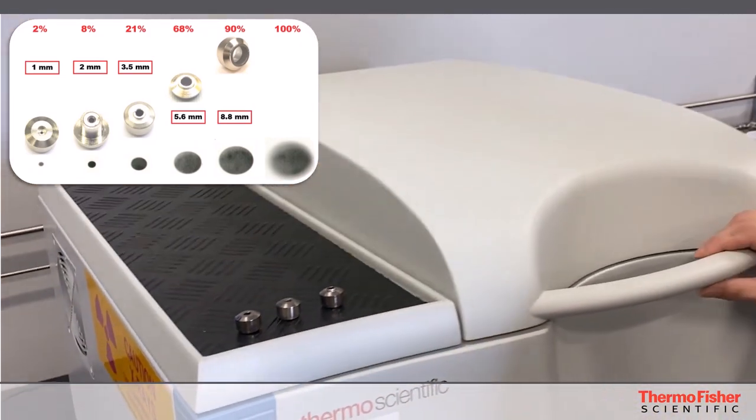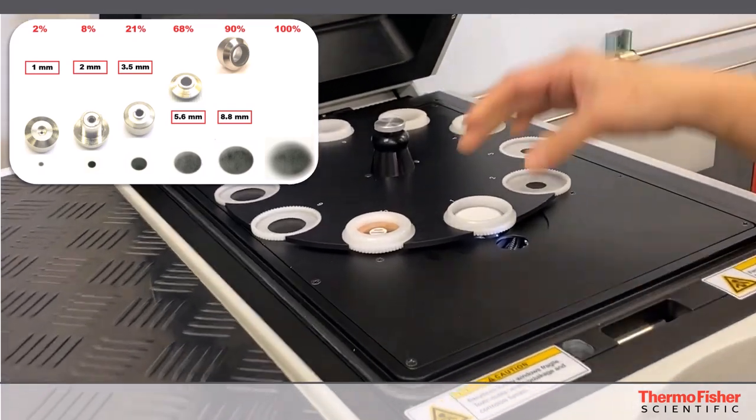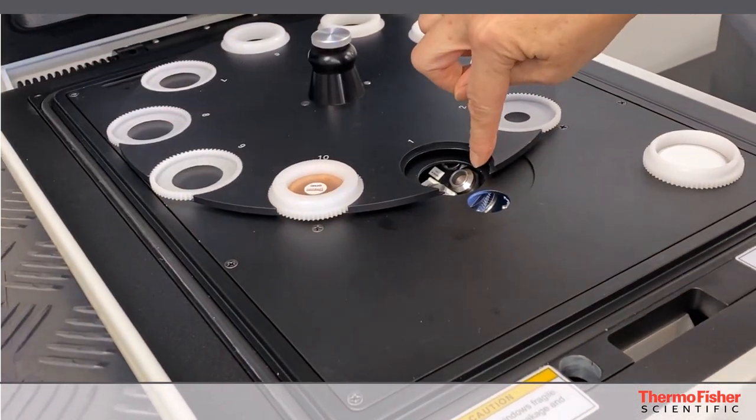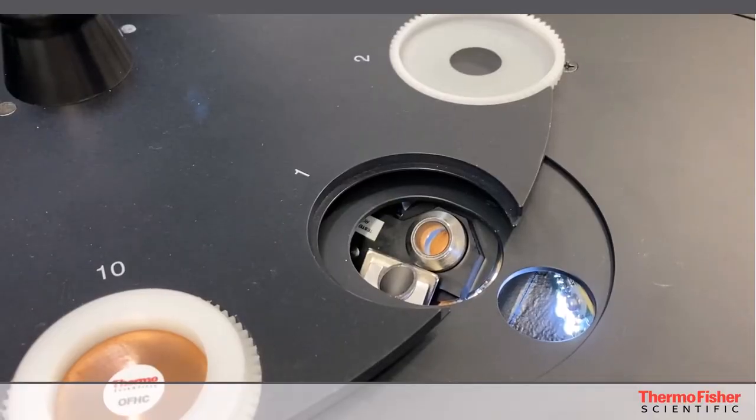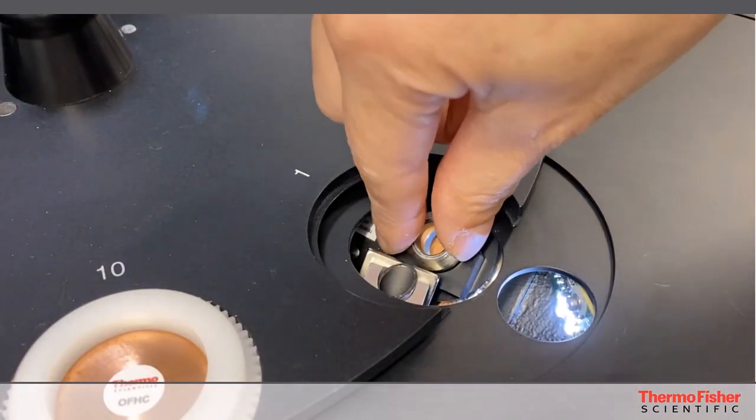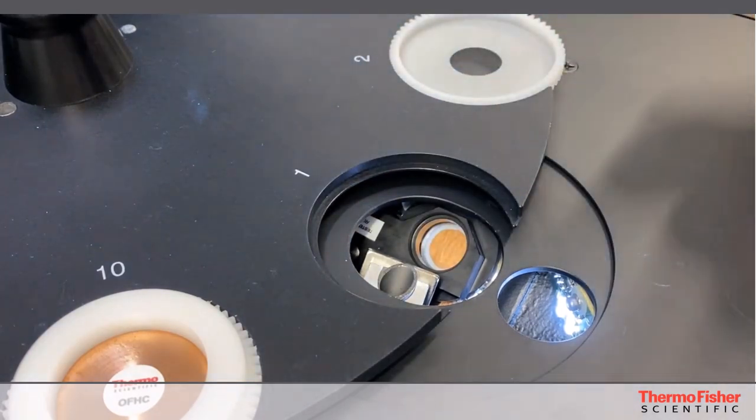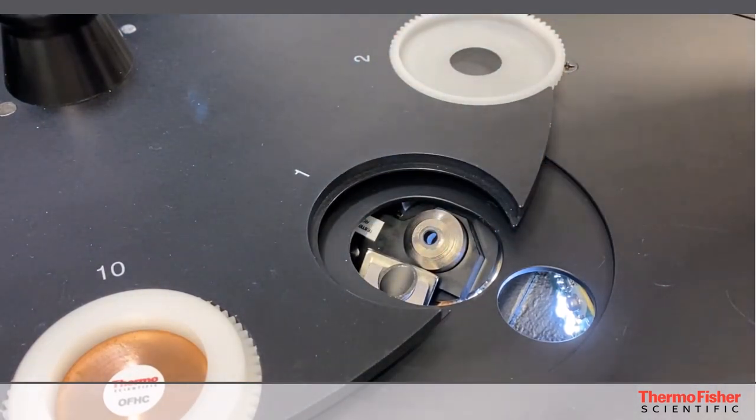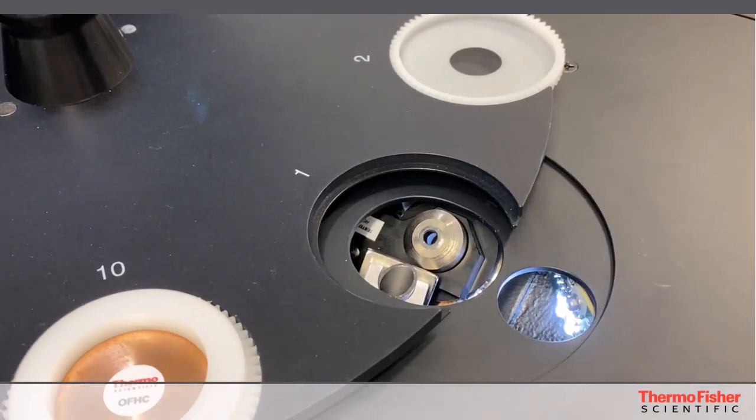Okay, and to change it out all you have to do is take out the position one and it's located right here on the primary beam side. So to replace the collimator it's extremely simple, all you have to do is remove it with your fingertips and put in a new one. So there are no screws, no tools, no alignment necessary.